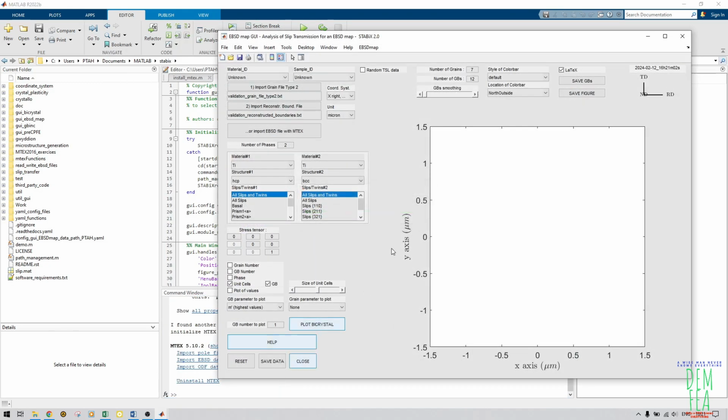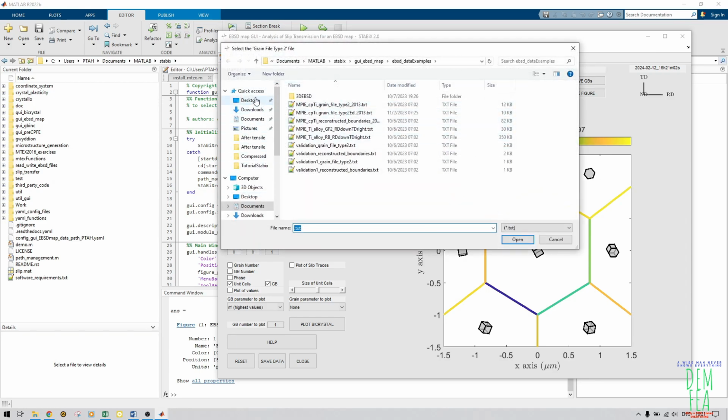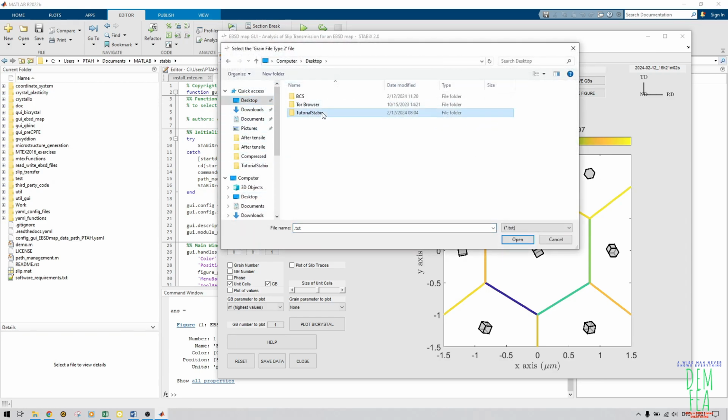Now I wait. As you can see, what I was telling you about is this coordinate system. You must make sure that you know the right coordinate system for your data, otherwise you'll have problems. So we import grain file type 2. Here we come to my desktop and then come here. Grain file type, as you can see, it's written here: select the grain file type. So you will not have any problems or confusion. But in case that happens, you'll get an error here. So let's import this file.